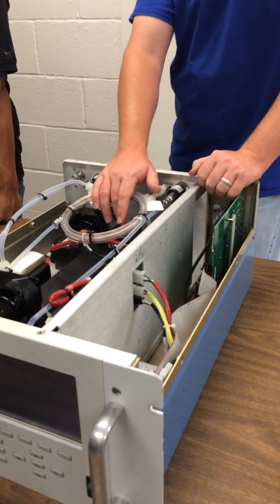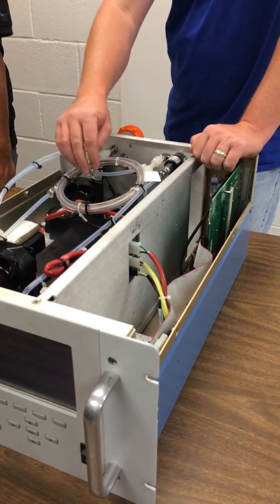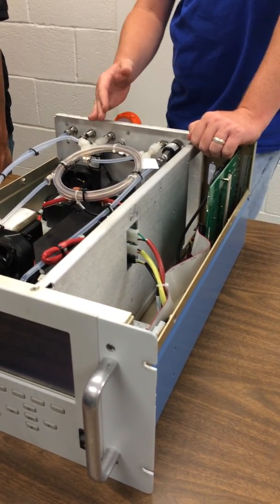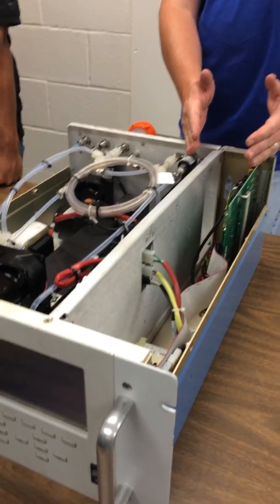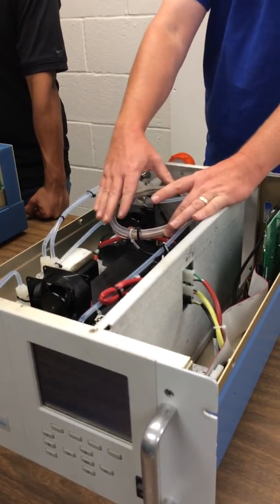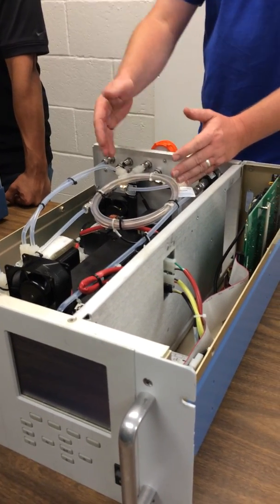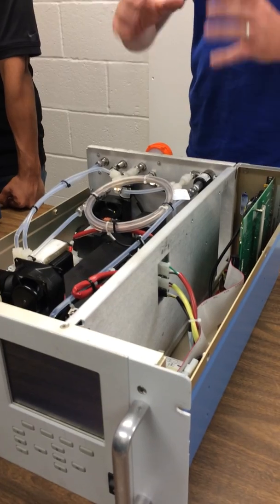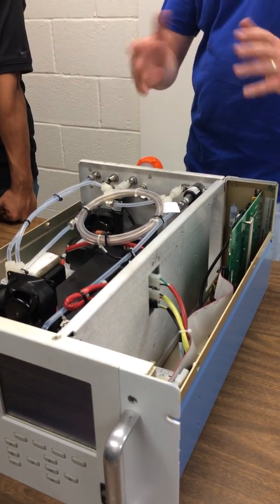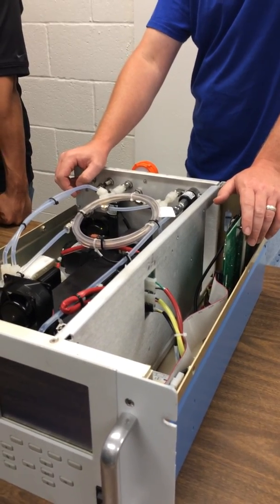This is the detector. And so what it's doing is it's measuring, while you're measuring with the IR source shining through the nitrogen cell, you're measuring ambient CO. That's the absorption. In theory, we've taken all the other absorbers at this wavelength out through the dryer. So we're measuring CO. And the other half of the wheel, we're measuring ambient CO plus the CO in the wheel. So it's taking the ratio of those in order to get what the ambient concentration is.